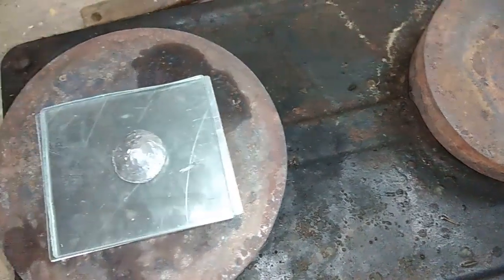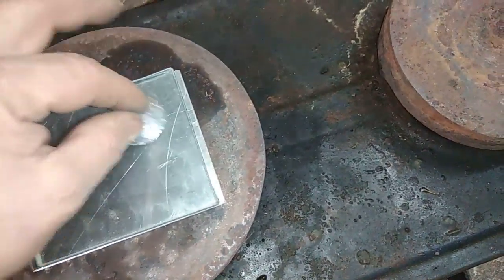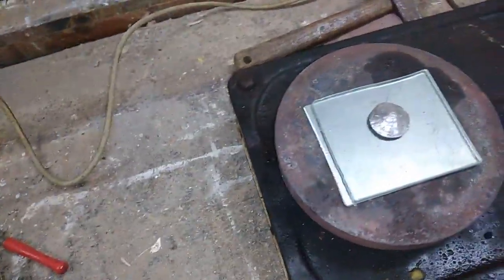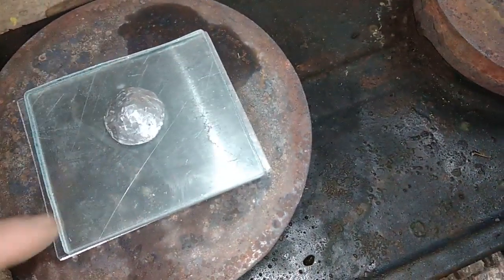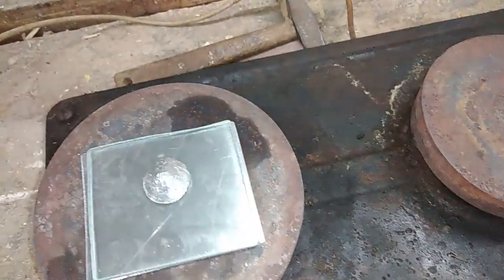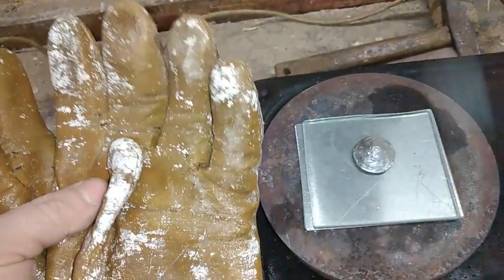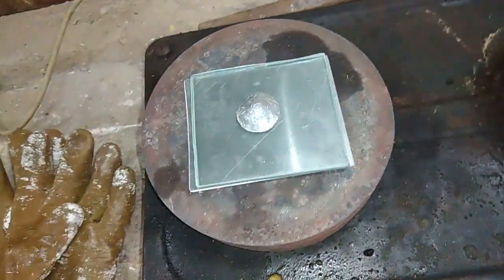So I will put that indium like this, and when everything is heated, try to spread this indium over every piece of the glass. We got everything here. First, I will need some gloves. Here we go — my dirty gloves. And second, I already have my glasses, because you don't want to risk the glass breaking and hurting yourself. So always take some security measures: take gloves, take glasses, and the gas mask of course, because of the vaporization from the indium. Let's start.